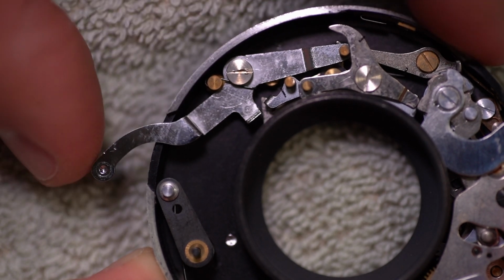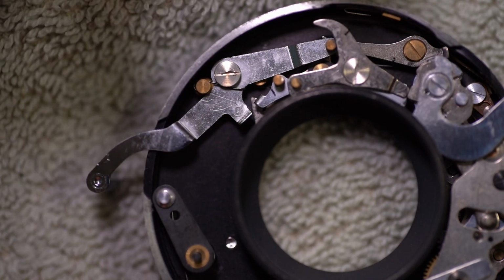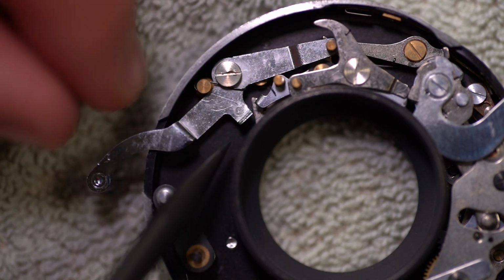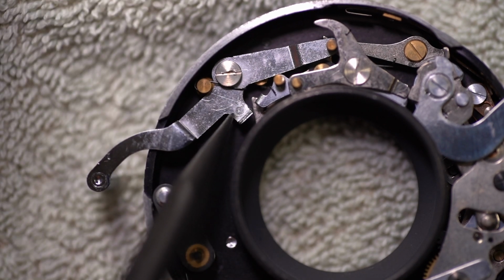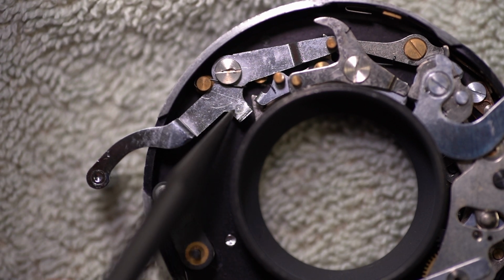And now it's working. Now, I don't know why it's working now. You can't really feel it, but I can feel this. And earlier it wasn't working. I think the problem with this is the pin that's on the bottom of this thing. And there's no way I'm going to be able to show it to you, but take my word for it, there's a pin. And you might be able to see there's a little divot here.